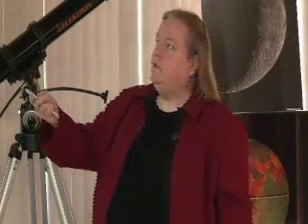Single angstroms, you have to have a pretty good microscope to see them. This is something called F-actin. It's like a strand of a protein, and you can definitely see the segmented nature of it. So that's a pretty image of 800 by 800 nanometers. So it's a pretty good sized molecule.